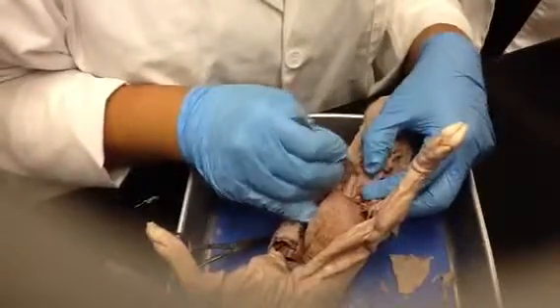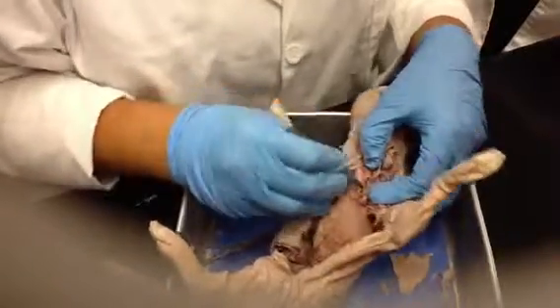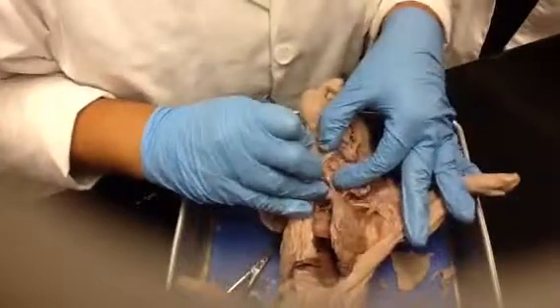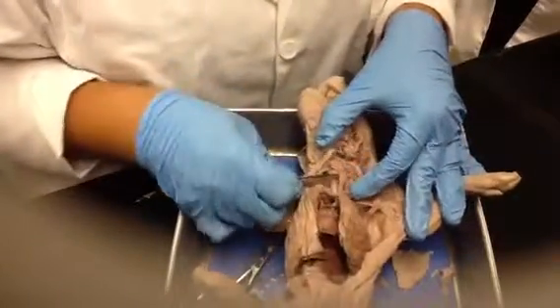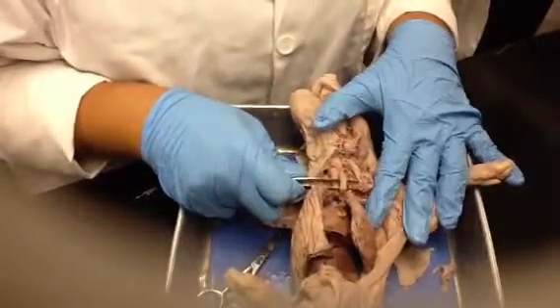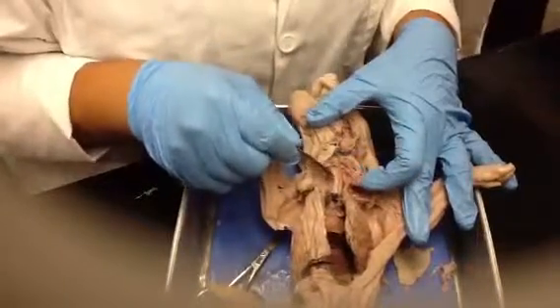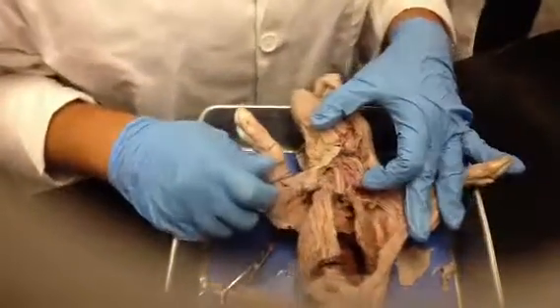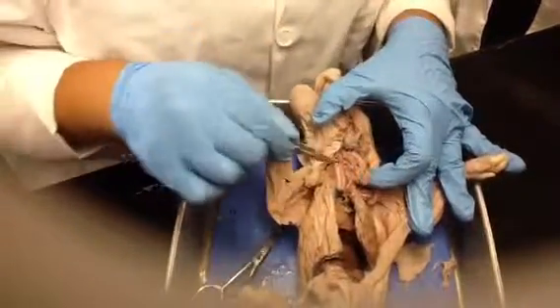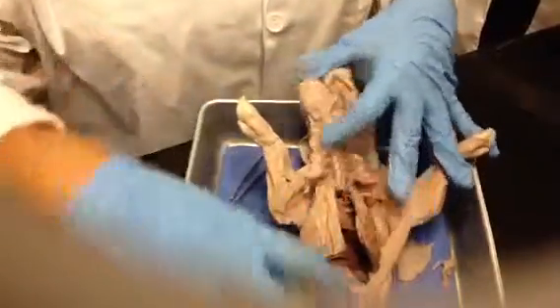Okay, so the esophagus, soft. Obviously it's not going to have any cartilage rings to it. It's going to be flat. Looks color-wise like pretty much everything else. That's your esophagus. Notice that it's a little bit behind the trachea, a little bit to the side, so it would be postero-lateral, right? So posterolateral. Alright, so that's your esophagus.